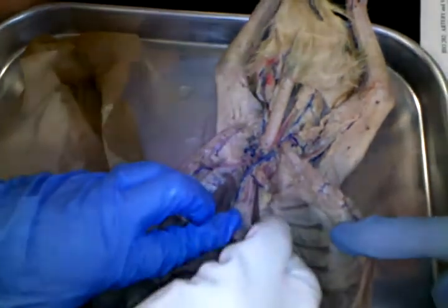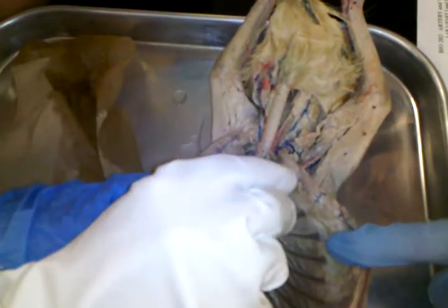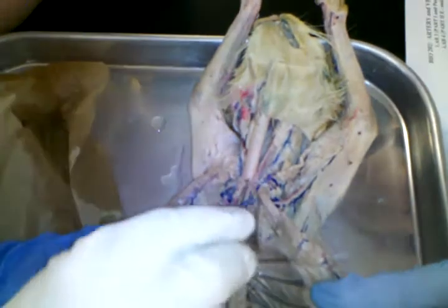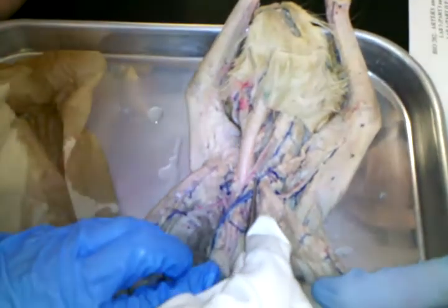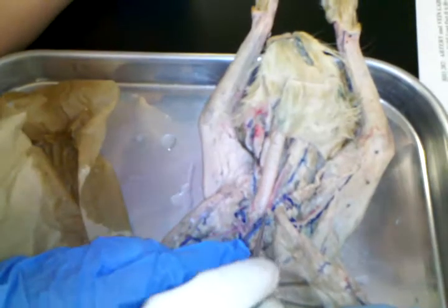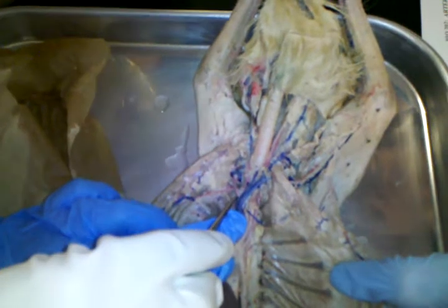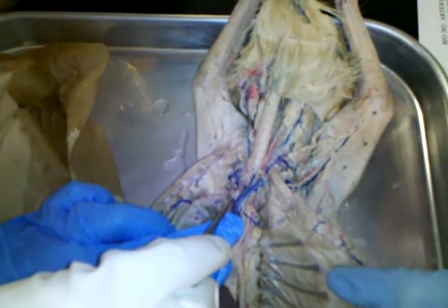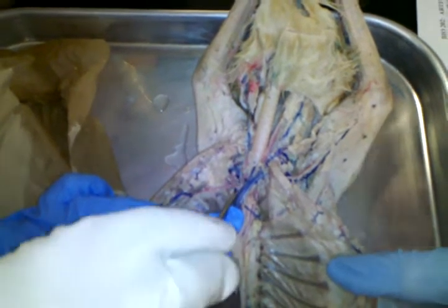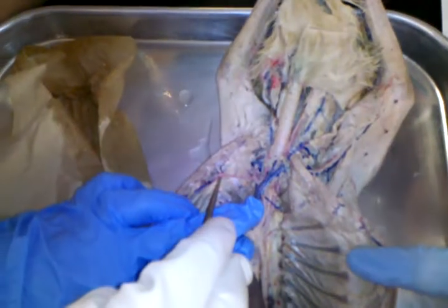And so what you can see branching off of the brachiocephalic is the carotid. That's not a carotid, that's actually the vagus nerve. But this red one is the carotid, left common carotid, right common carotid, and then the one that comes off, this one's called the subclavian, because it's always your patient's right or left, so this is the right subclavian.